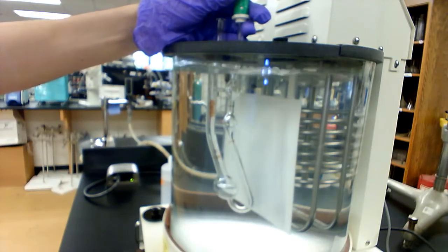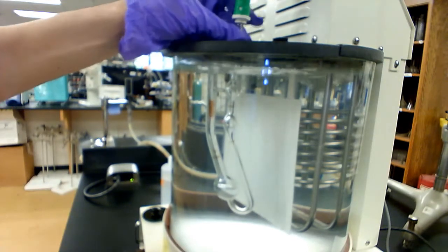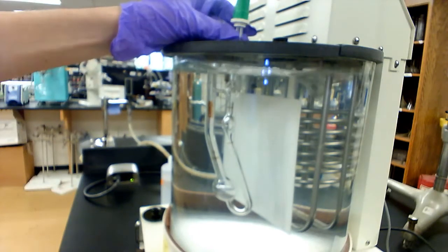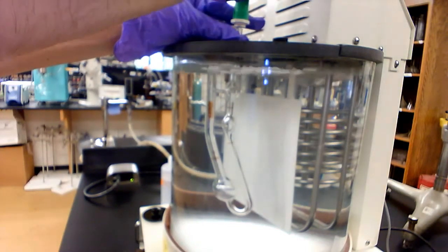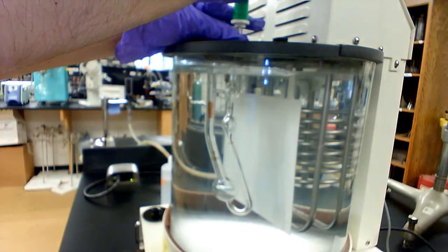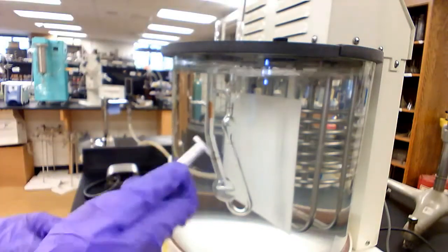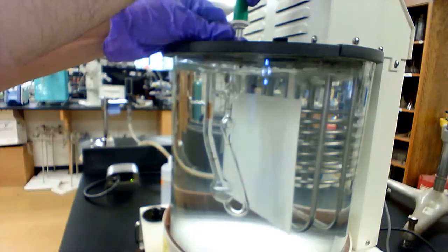Using the flow time and water, we can find the B constant of this viscometer. That B constant is then used to find the viscosity of our unknown liquid — an alcohol or a polymer. Let's do it together. I'm going to attach the pipetter to the right-hand side of the viscometer and draw the liquid up. Sometimes it is required to detach the pipetter and keep drawing afterwards.